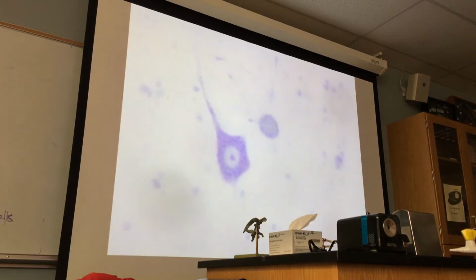And you can see, this is a very feeble reaction. Can you see that? You can trace the axon up to here, but very feeble, not much RNA. You can clearly identify the axon, especially the initial segment, and also the axon hillock.